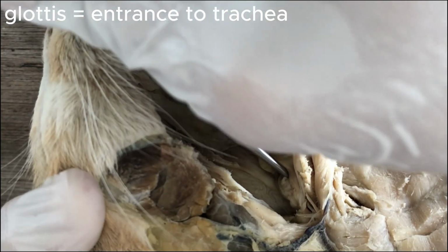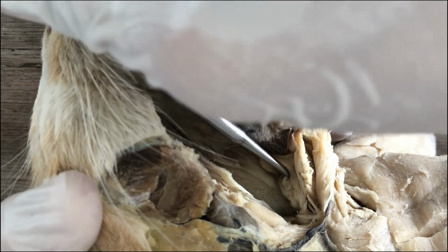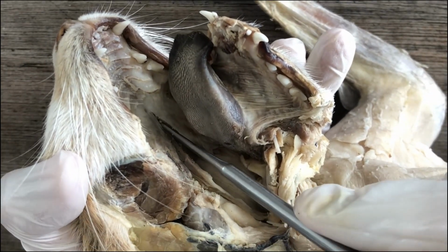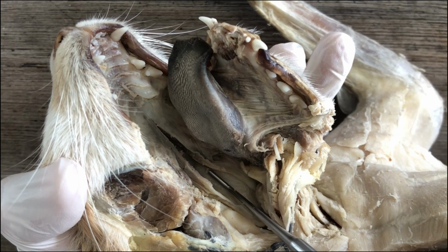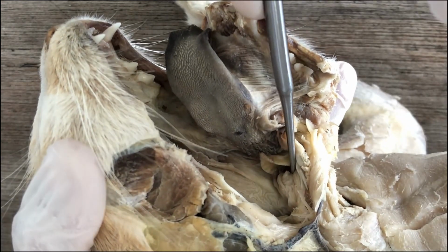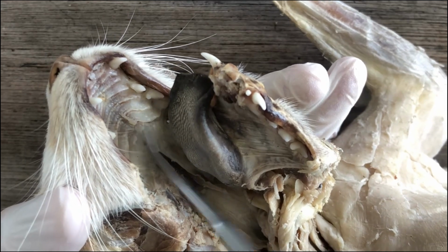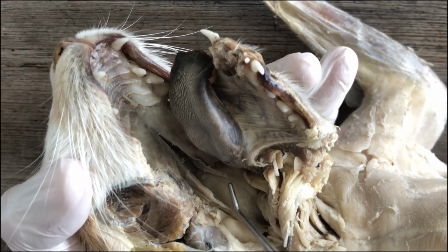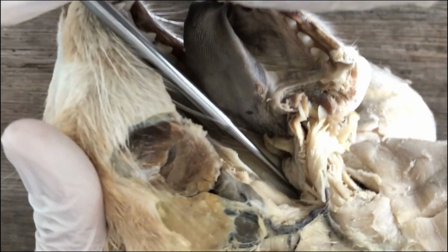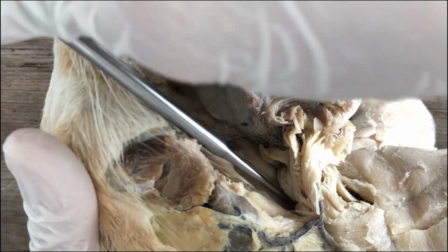So that's where air goes. Okay? So the air coming from the nasal cavity to the nasopharynx should go to this tube, whereas the food and water coming from the oral cavity and then the oropharyngeal cavity should go down this tube, the esophagus.